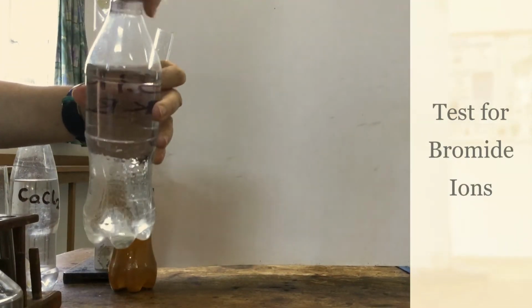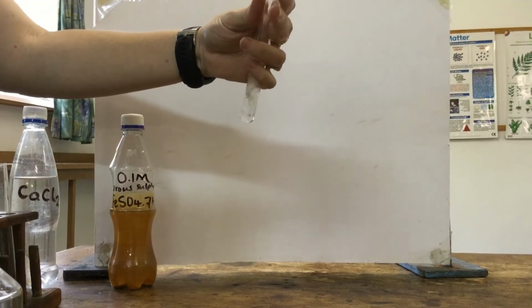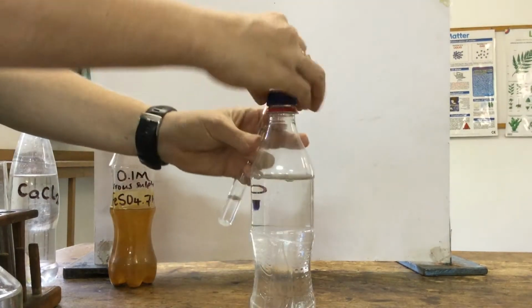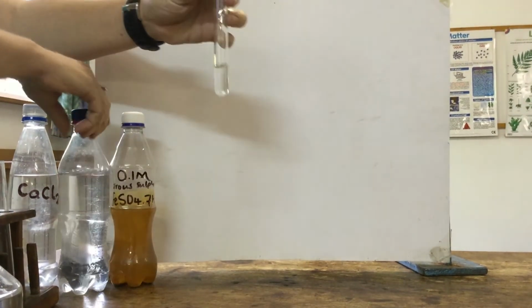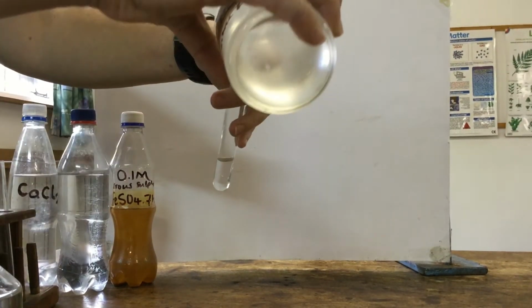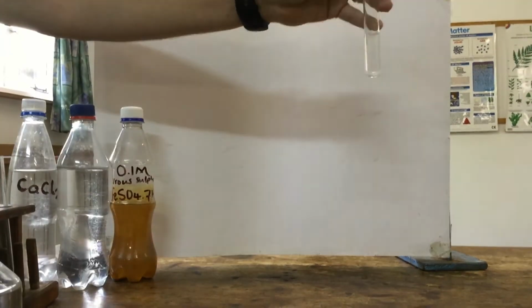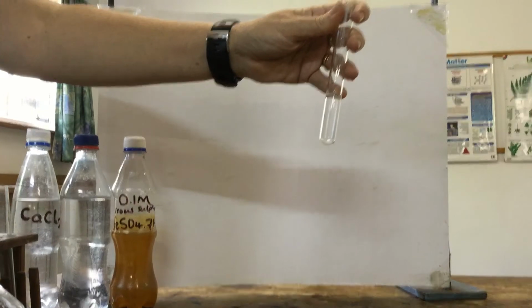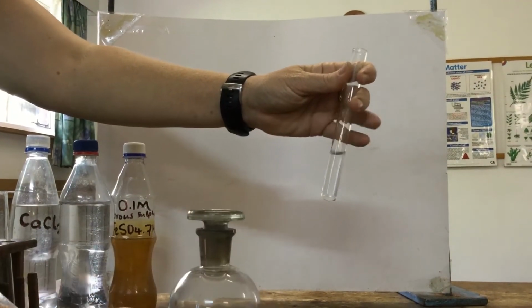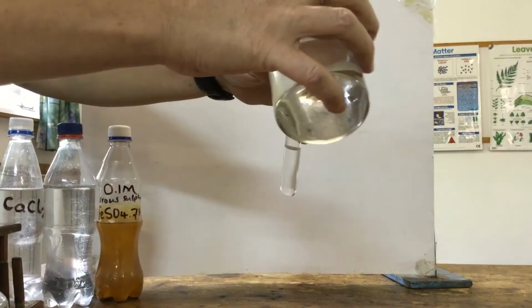Next we'll move on to bromide. Same group, also a halogen. Again we're going to add some potassium bromide, which I have this time, to our test tube. Same procedure, we're going to acidify with nitric acid to remove any carbonate ions that might be there. Okay, no bubbles, so there weren't actually any carbonate ions. And then again, we're going to use the same reagent, silver nitrate, and this time we should see a creamy precipitate forming if there are bromide ions.